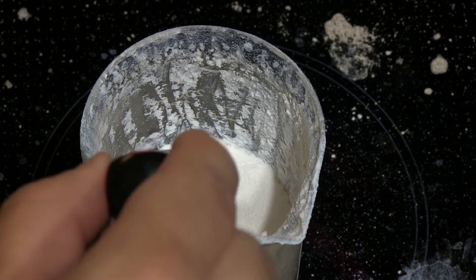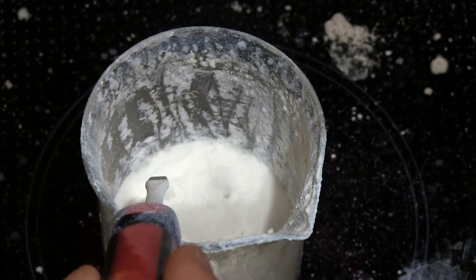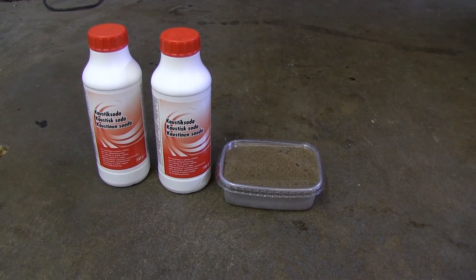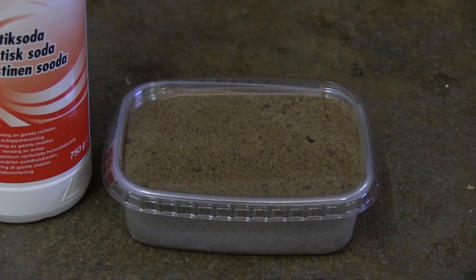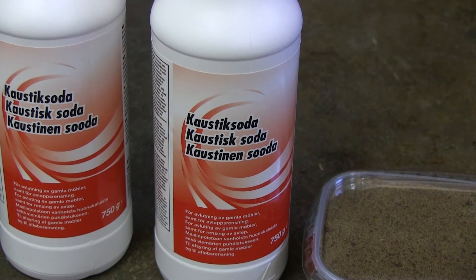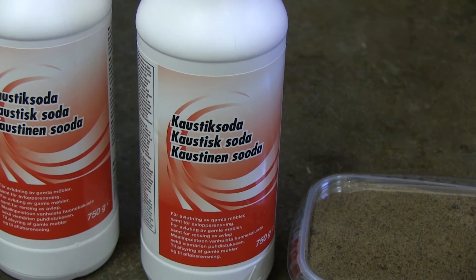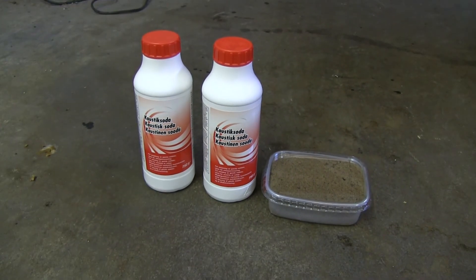The future me will inject commentary whenever needed, but I'll let past me handle most of the explaining. If you only wanted the procedure, you may quit now. Hello YouTube — I am going to try to synthesize sodium silicate using sand that I stole from a local playground. I found some sodium hydroxide that's most likely 60 to 90 percent pure. I have no idea what the rest of it is, most likely sodium chloride.